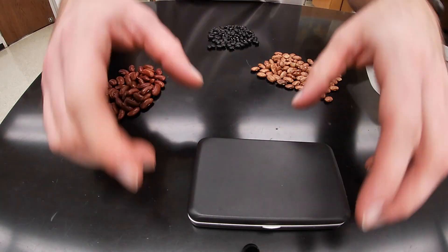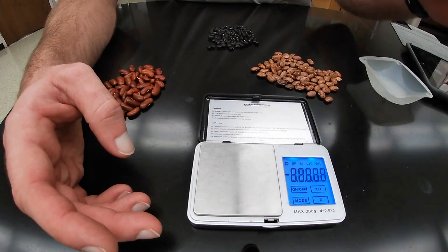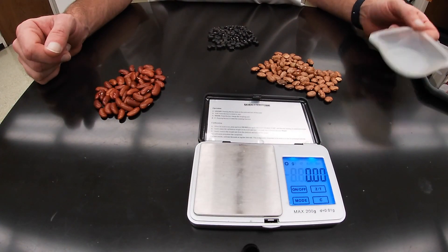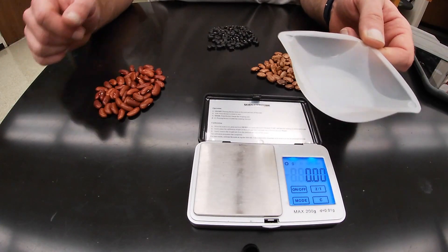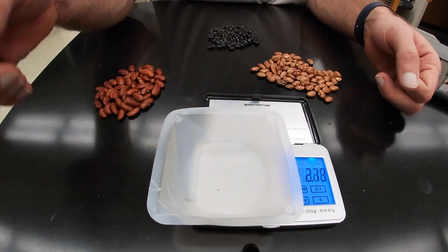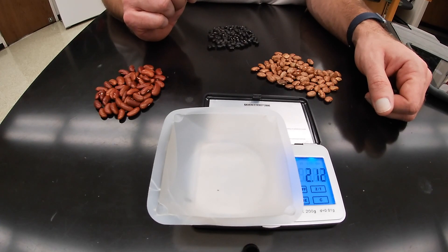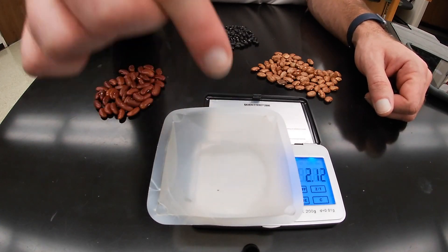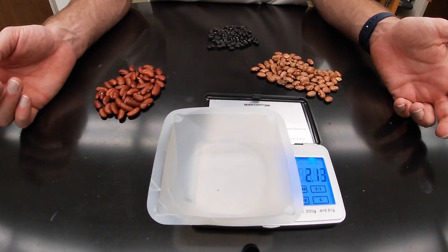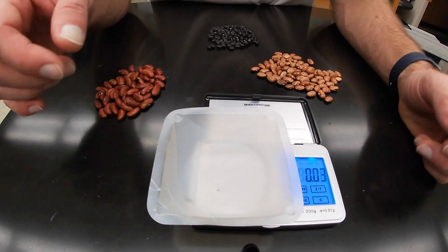Next I want to get the mass of each pile. I'll zero my balance and also tare the weighing boat so the balance does not detect the mass of the weighing boat. That way, anything I put in the weighing boat will just give the mass of whatever is in there. So I'm going to hit zero or tare.